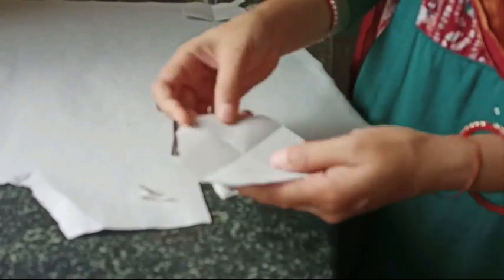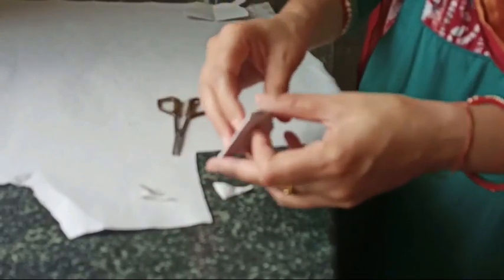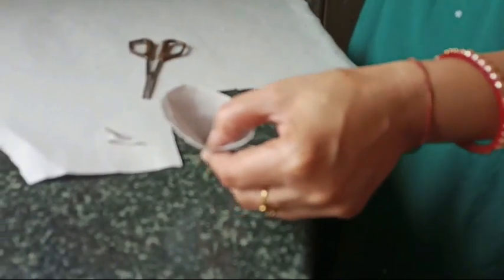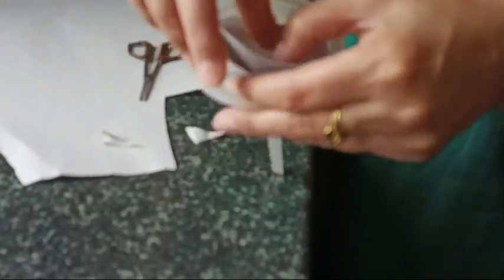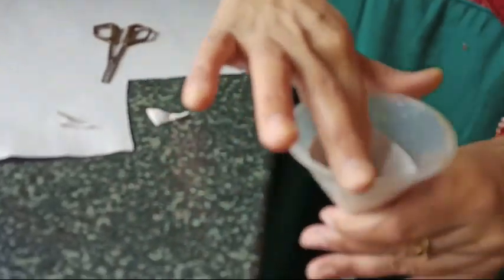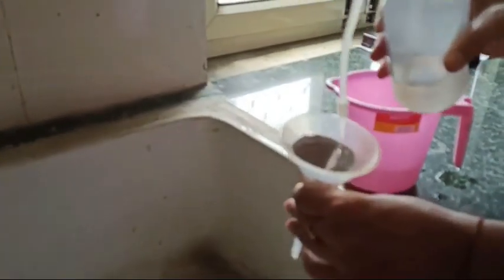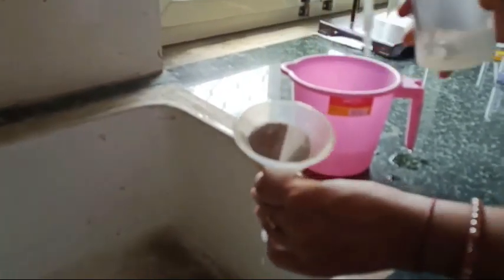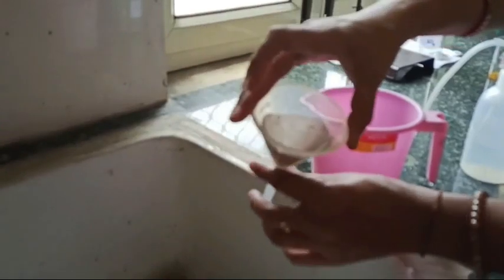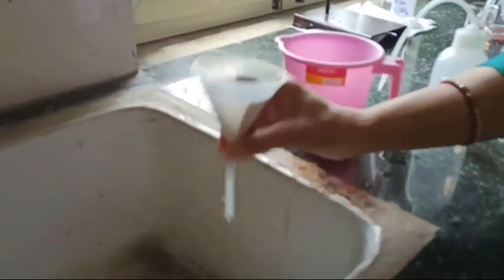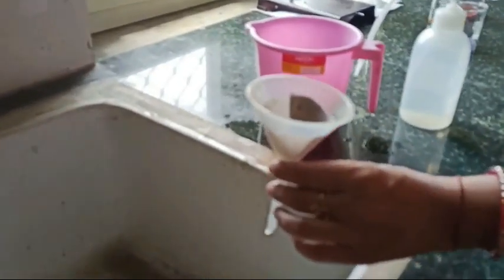Then get one side of this. Here you see, you just get one side - three sides are on same side - and in this way you keep this inside the funnel. And before using this funnel you just wet this with your solvent. So as I use water, I wash this or wet this with the solvent so that it won't absorb all the solvent.